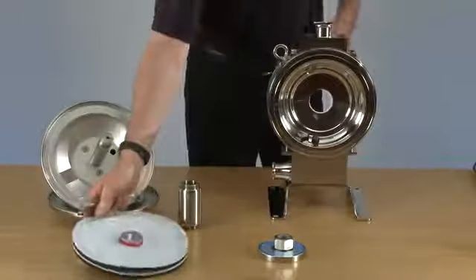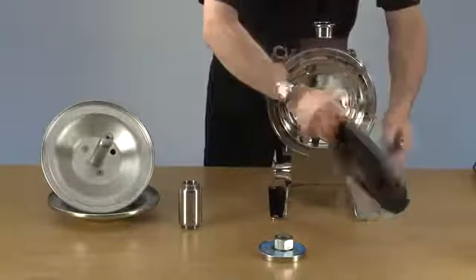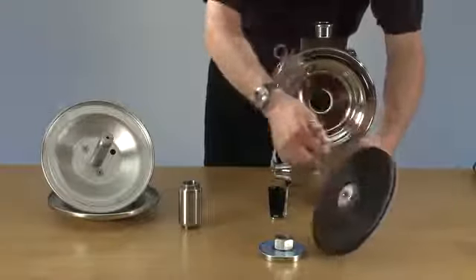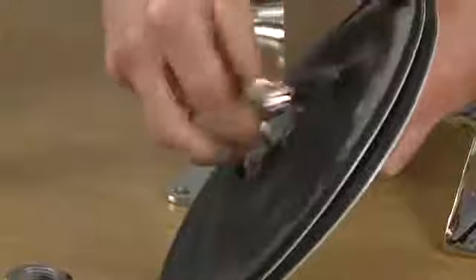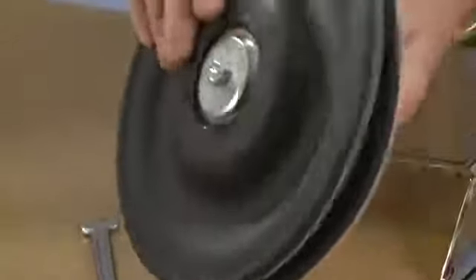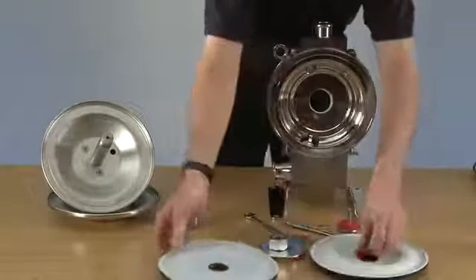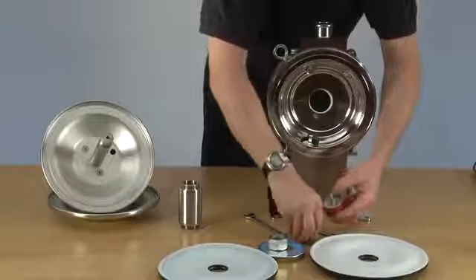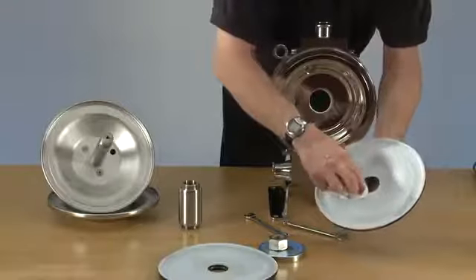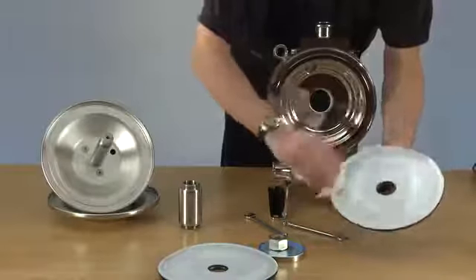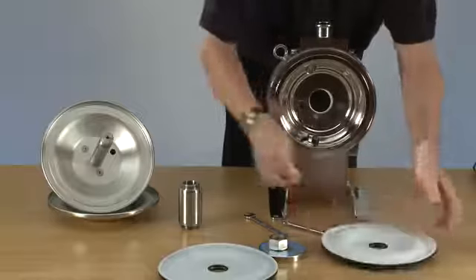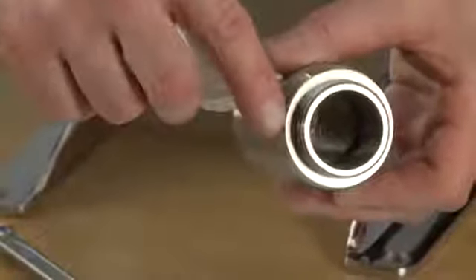So now we're going to take the diaphragms and we're going to remove the clamping. You need to make sure the seal is clean. And the same around the nose at the thrust tube.